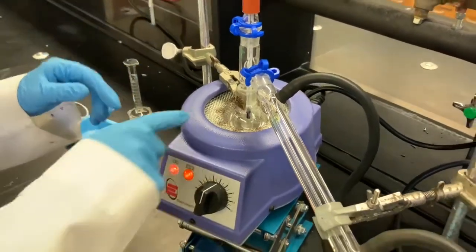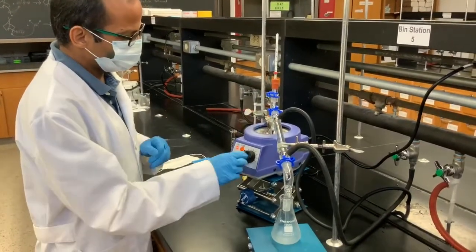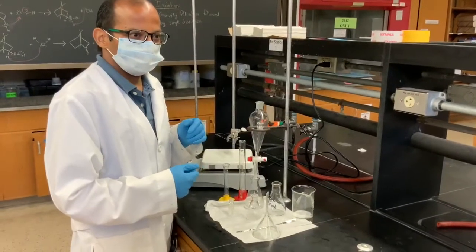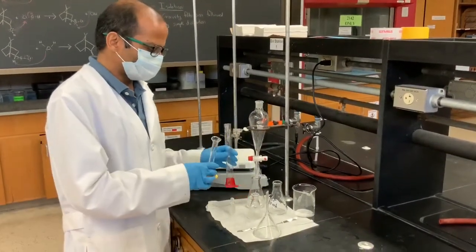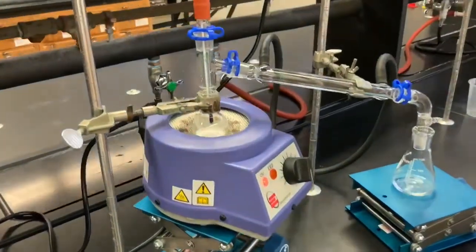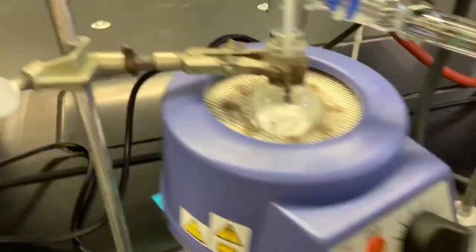Our distillation assembly is set up and you can see the ether starting to boil — very soon it will condense in the collection container and all the ether will evaporate and condense there. While it is distilling, now is a good time to start cleaning up the dirty glassware, because all glassware must be cleaned and dried for the next student who will run this reaction. With the distillation completed, we can tell there is no more liquid left in the round bottom flask. All that white solid is our product — it's our camphor. What came out of the distillation is all diethyl ether.